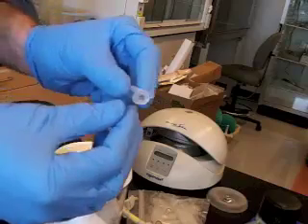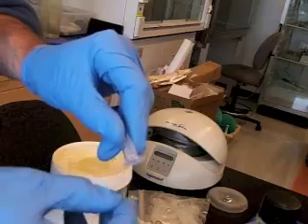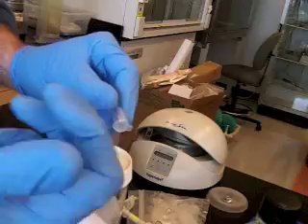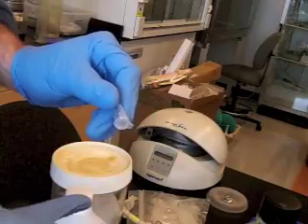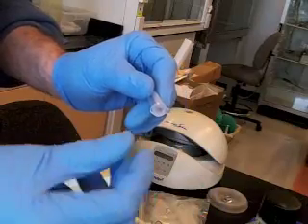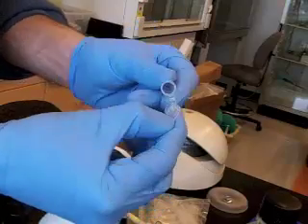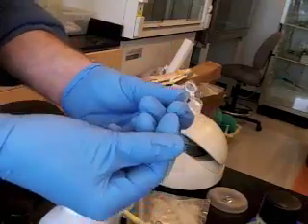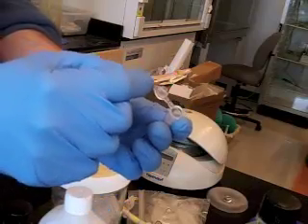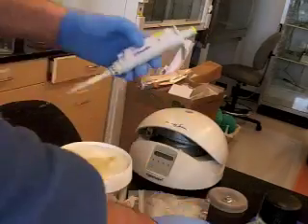And then when you uncap it, these have a little thumb flange, and you want to try to just use the edge of your thumb. Lots of times the gloves will be sort of loose on your fingers, and it's good to pull them back. It's good to wear gloves that are the appropriate size, so they're kind of tight on the tips of your fingers, so that you can open this up by opening it like this and bending it back. This hinge is plastic, so you actually have to actively bend it back to get it all the way, and you try hard not to touch that inner part of the cap or the inner part of the tube. And so, boom, like that.